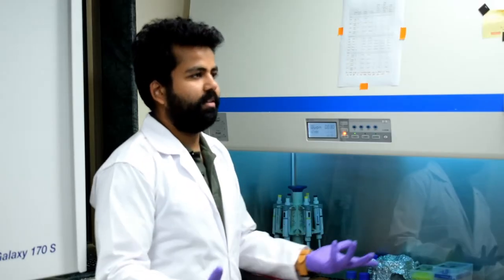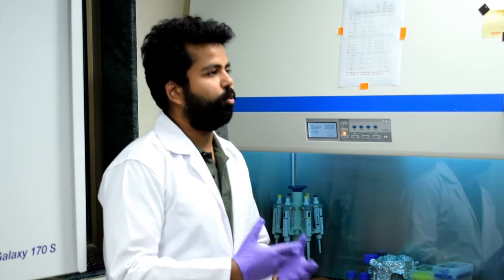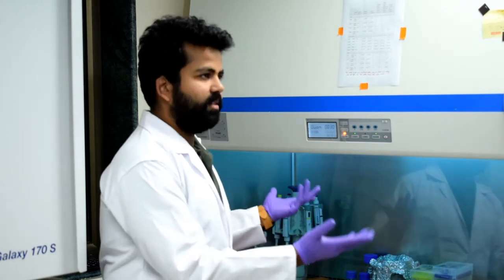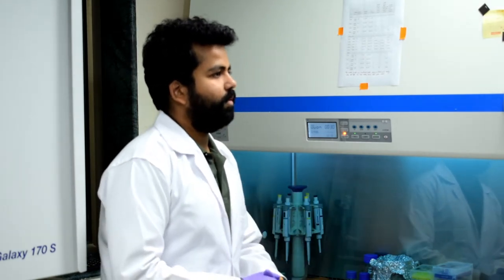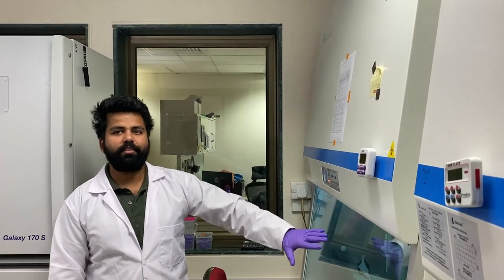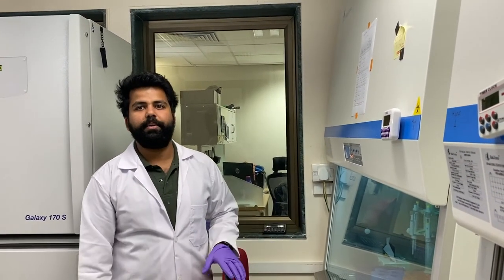Just as humans need to grow, we need to grow cells too. To do that we need certain specialized equipment and materials which we keep here. This is a laminar hood, and what I just switched on was ultraviolet light, to maintain a sterilized environment.